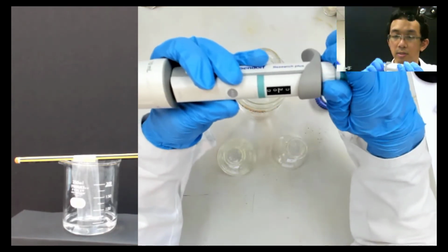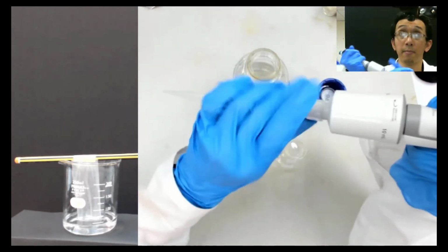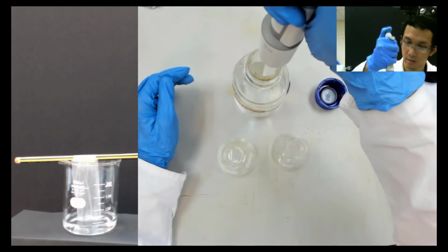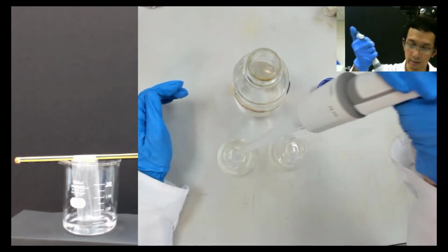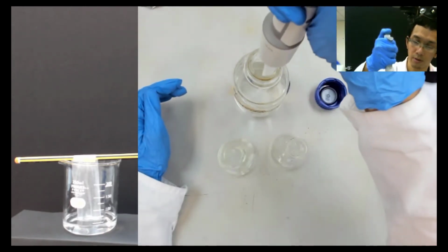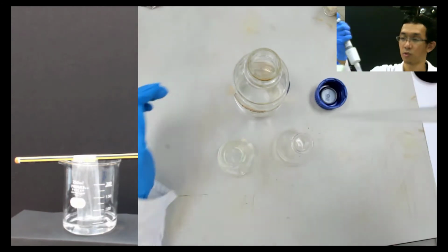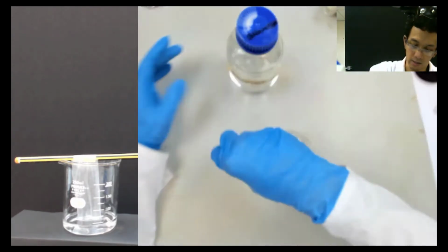So you just go 3 ml, and then I take the pipette tip here, and then I open, and then I just go. So that's 3 ml. And I put on X. And also I put on Y. Because you use the same solvent, it doesn't matter, you use the same pipette tips. Once you do that, I put it somewhere here, close that, and then you sort of shake it like this.